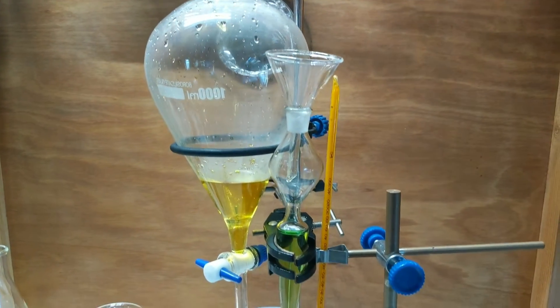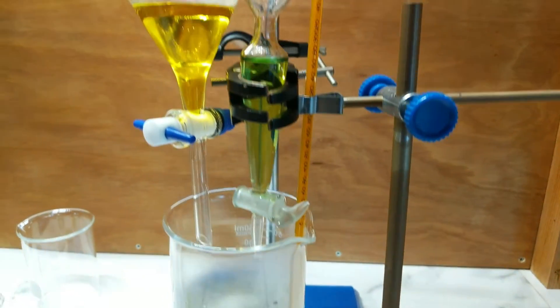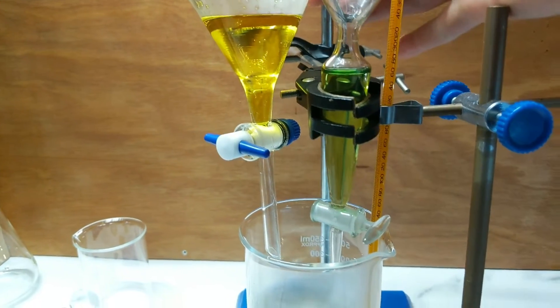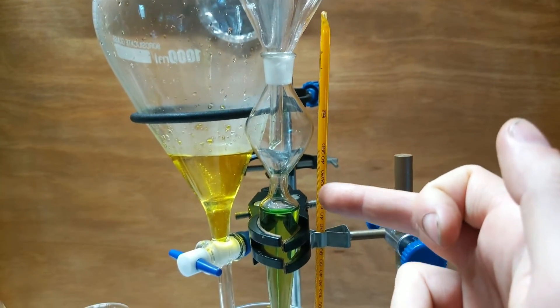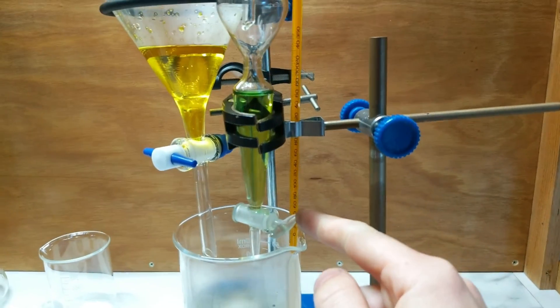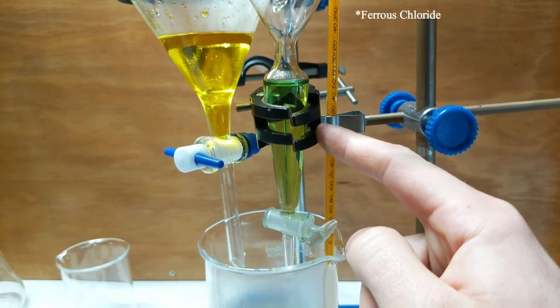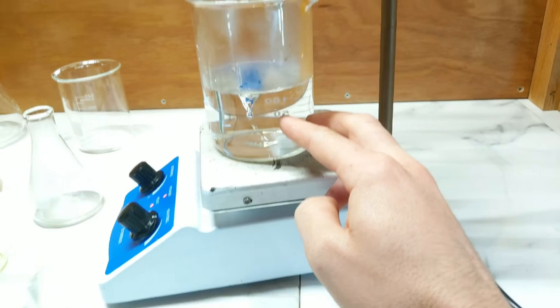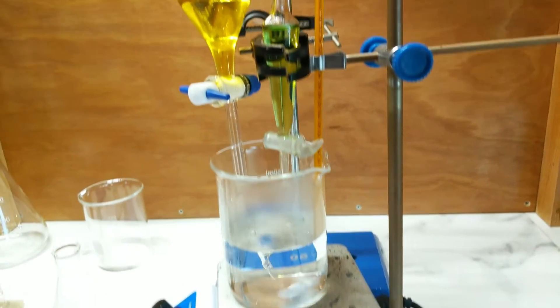This is the apparatus designed for the co-precipitation of the pigment. On one side is a large separatory funnel with the potassium ferricyanide solution. On the other is a very small separatory funnel-style piece picked up from a flea market in Paris, which holds the ferrous chloride. The two will be dripped into a warm, constantly stirred water solution, and hopefully a blue precipitate should form almost immediately.